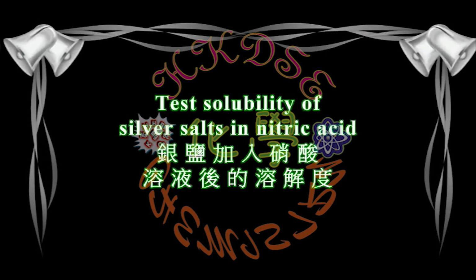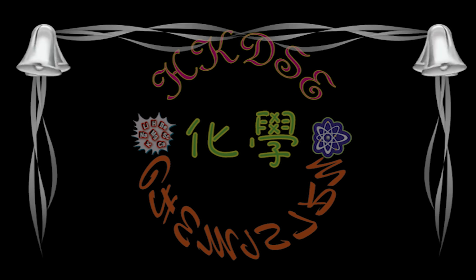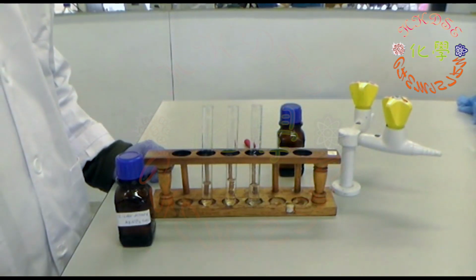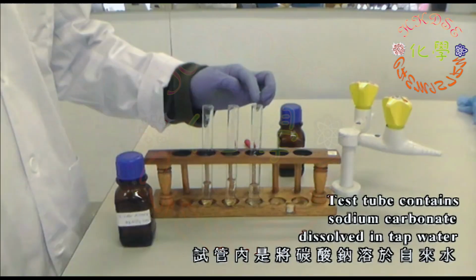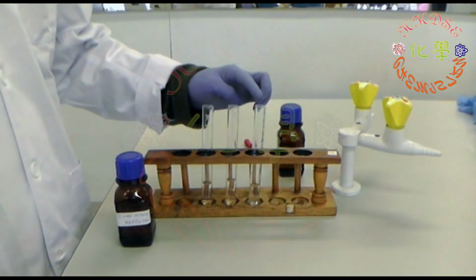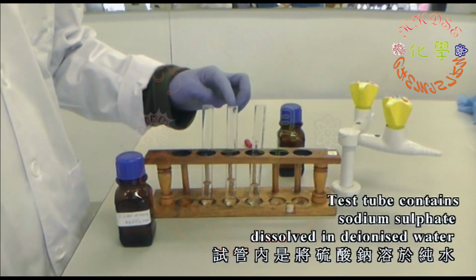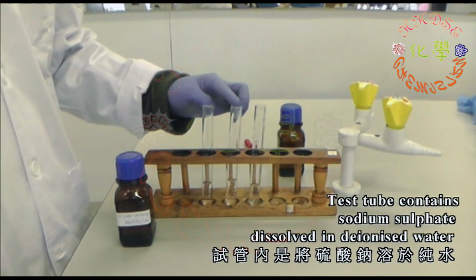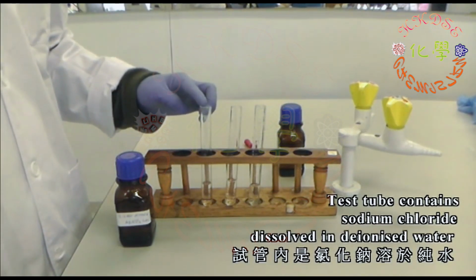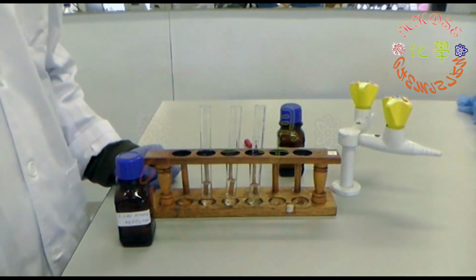Test solubility of silver salts in nitric acid. The test tube on the right is filled with sodium carbonate, dissolved in tap water. The test tube in the middle is filled with sodium sulfate, dissolved in deionized water. And the test tube on the left is filled with sodium chloride, dissolved in deionized water.